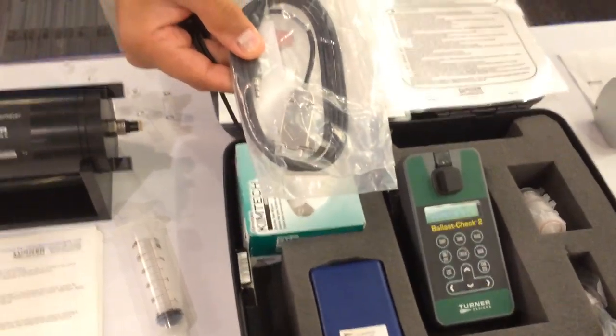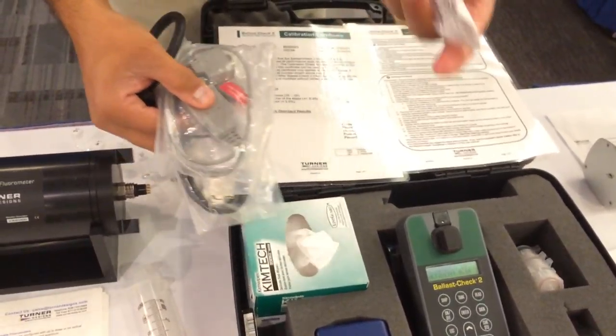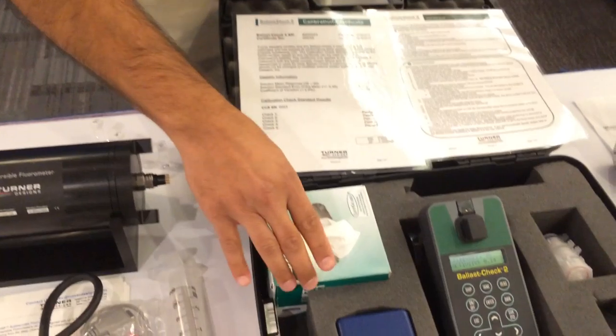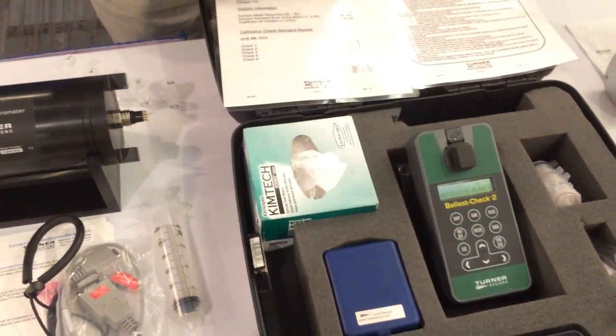You also get an RS-232 cable, USB cable, USB drive, and the most important thing — a box of KimWipes.